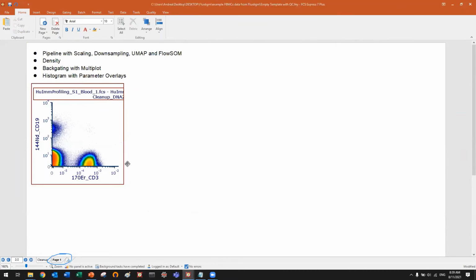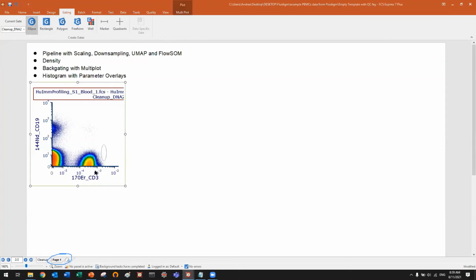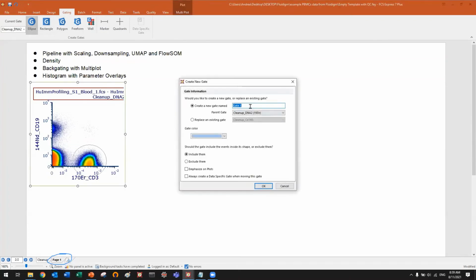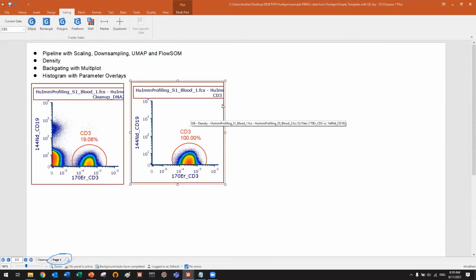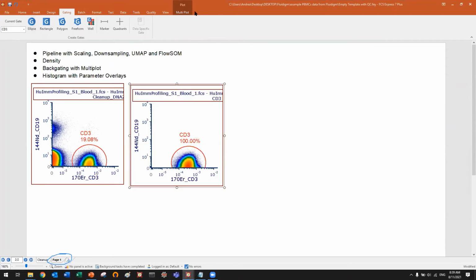So first thing to do, let's create a gate to identify the population of interest, the population on which we want to run the high dimensional data analysis. Let's say that we want to focus on CD3. It's just an example. Of course, you can focus on whatever you want. You can focus on T cells, B cells, all cells, total blood, whatever. So let me call it CD3. Let's do it red. And now I will open a plot and I will keep it there. It's just a plot displaying CD3, nothing special. But this is the plot on which I will display my high dimensional data analysis results.